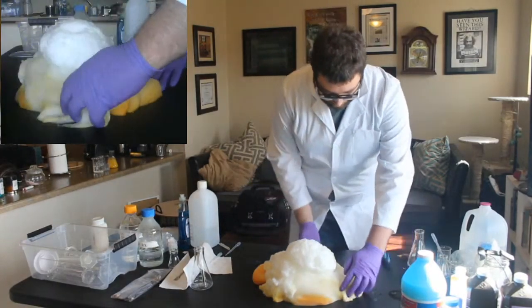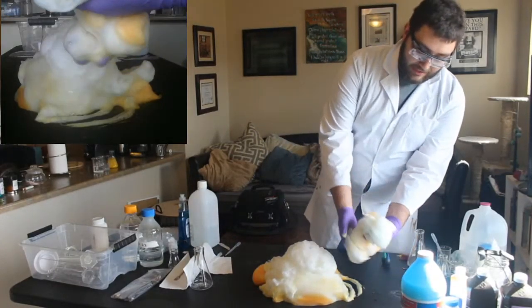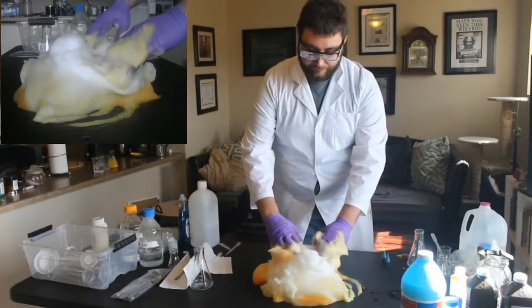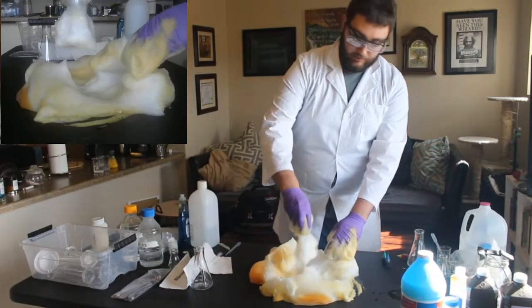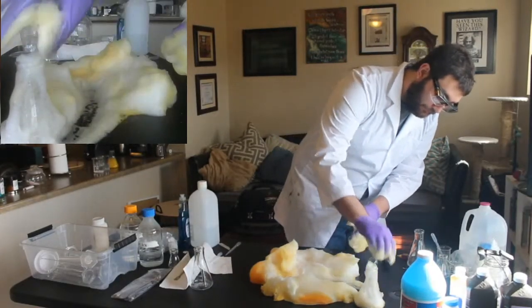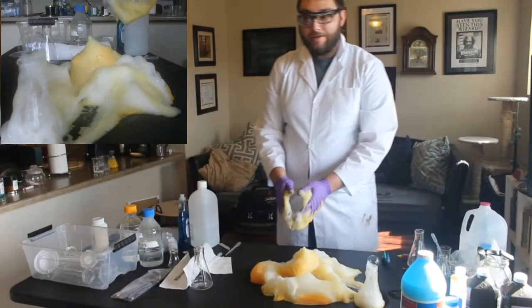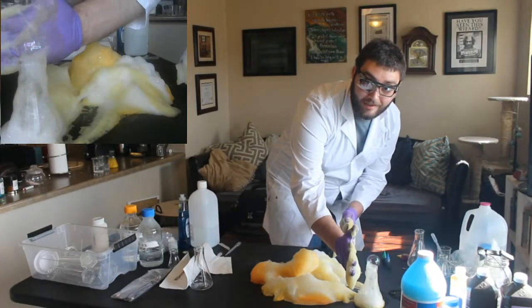So, because we're good scientists and we're wearing proper gloves to keep us safe, we can actually touch this, and it's this really goopy foam. But it's really hot, too. You can see, oh, hot. There's our container. It's so hot I can't really touch it. But it's almost empty because all of that stuff foamed up and out from that container. Oh, one perfect bubble right on top. Can you guys see that? Yeah, it's getting bigger and bigger. Right here, maybe that'll help. Yeah, that helps.